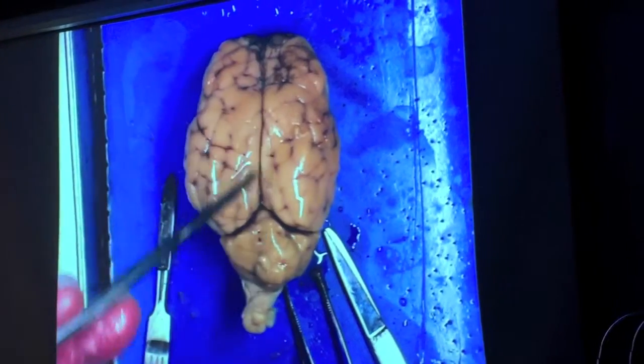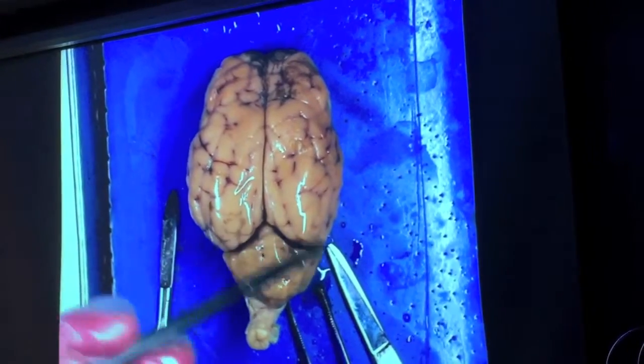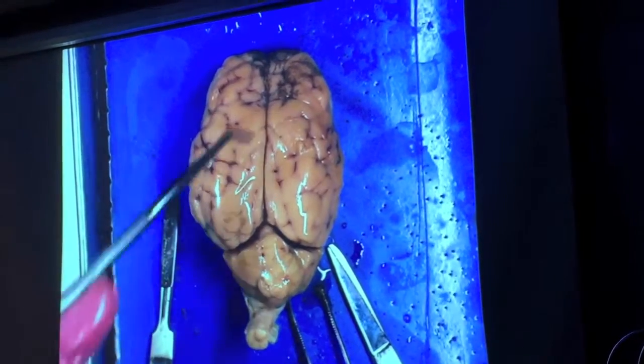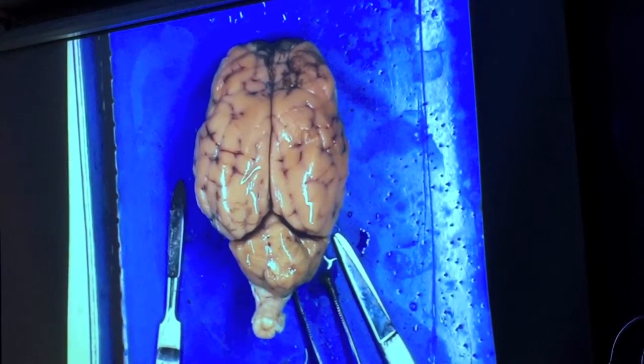You'll typically see a pretty clear line separating the brain into left and right halves, and then you'll have this third lumpy separate structure that's on the more caudal end of the brain. The portions up here, these are the cerebral cortex, the two halves of the cerebral cortex. So you have the left and right hemispheres.